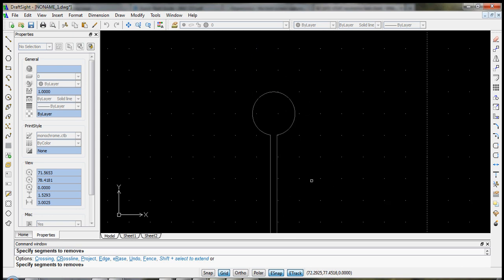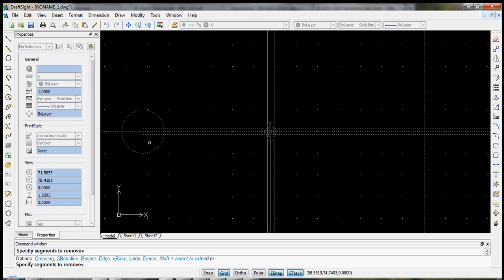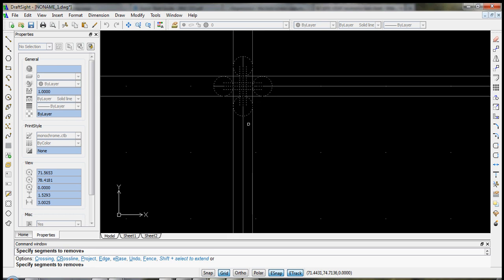So you can simply move around and start cutting out all of the elements that we don't need.